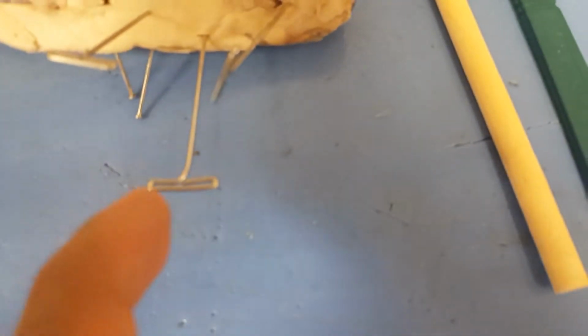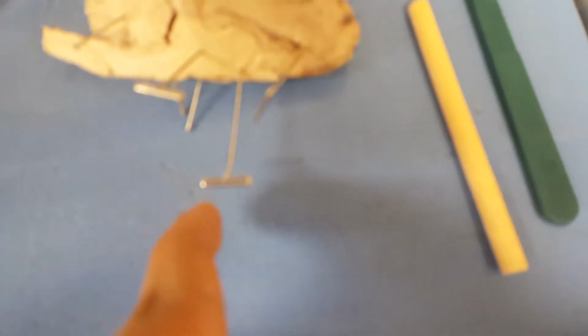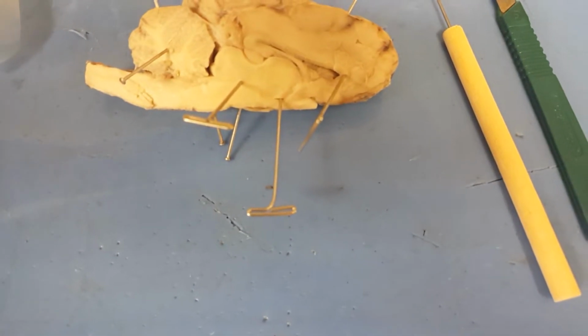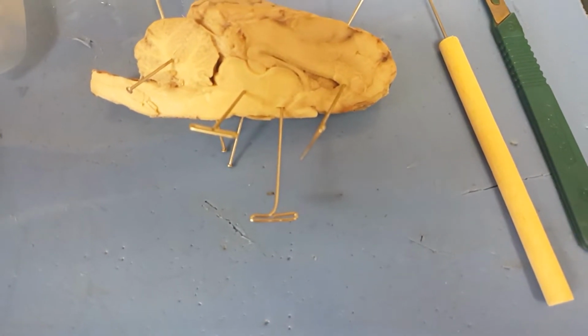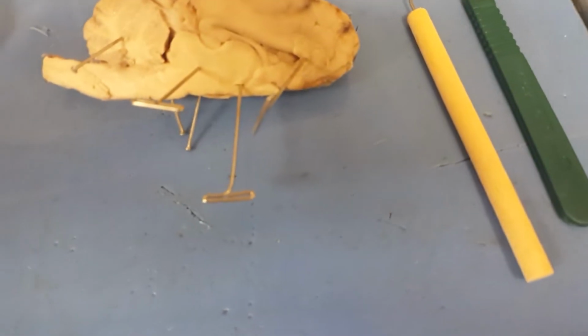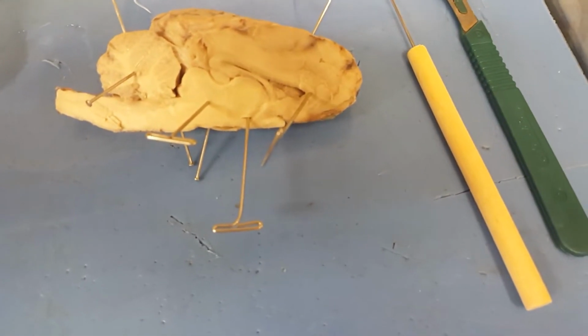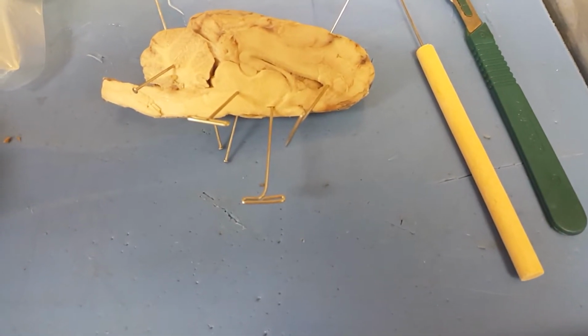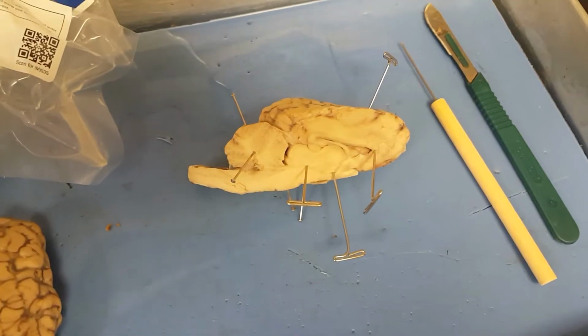Right over here is the hypothalamus, that one. That's a region of the forebrain below the thalamus that coordinates both the autonomic nervous system and the activity of the pituitary, controlling body temperature, thirst, hunger, and other homeostatic systems, and involved in sleep and emotional activity.